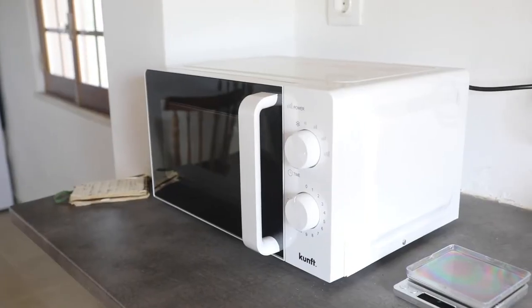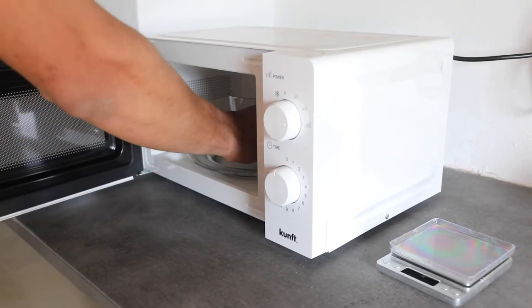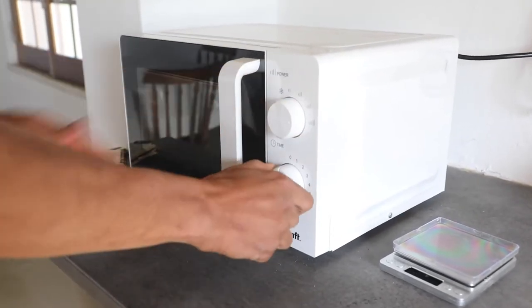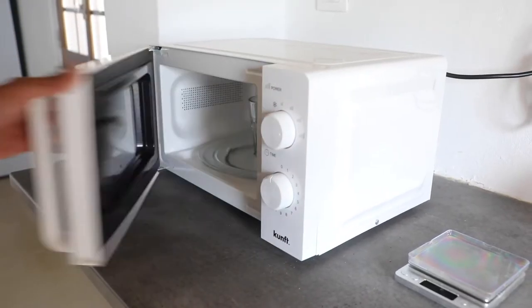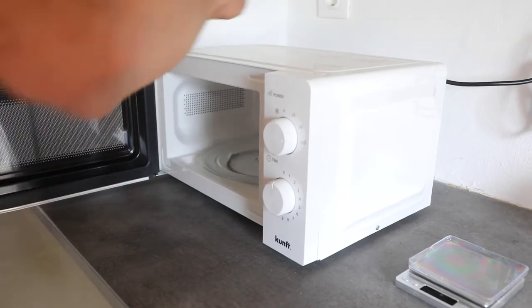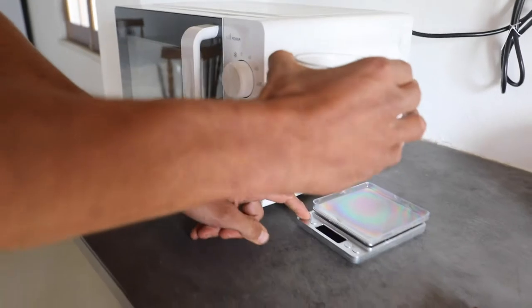Using a microwave, we place the cup containing the subsample in the microwave and dry for two or more four-minute cycles at full power. Open the microwave door for one minute between cycles to allow venting. Weigh the dry subsample in a cup and record in the datasheet.